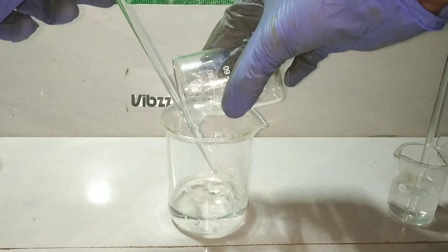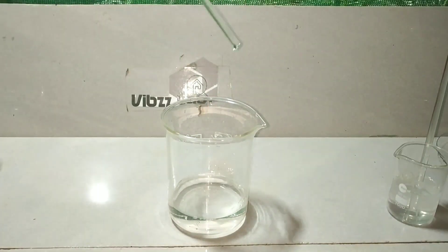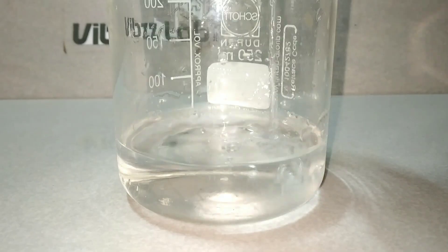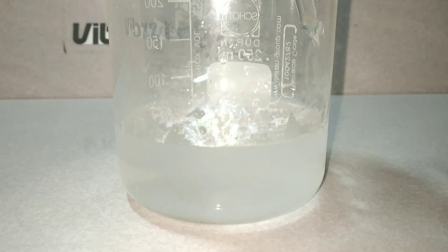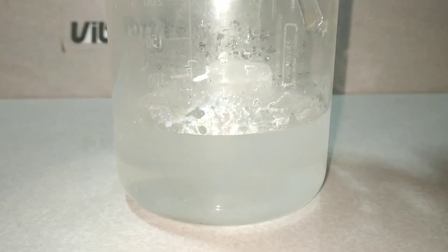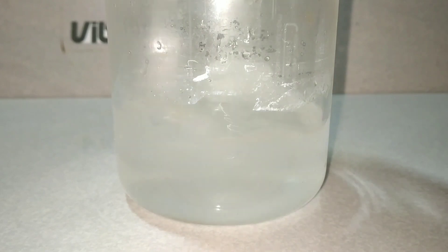Now I add the 30 ml of sodium hydroxide solution into the acid slowly, directing the flow with the help of the glass stirring rod. After addition of the sodium hydroxide, use the glass stirring rod to mix both the compounds.